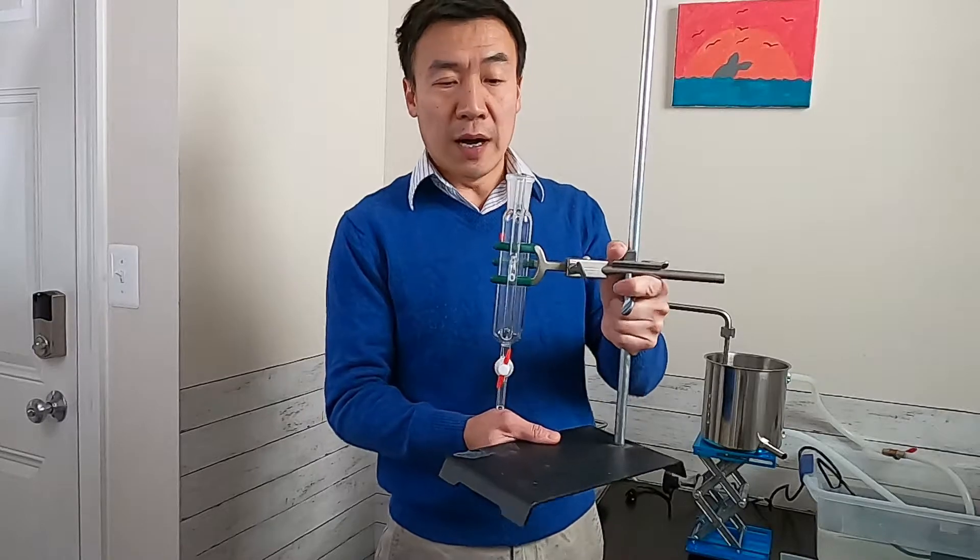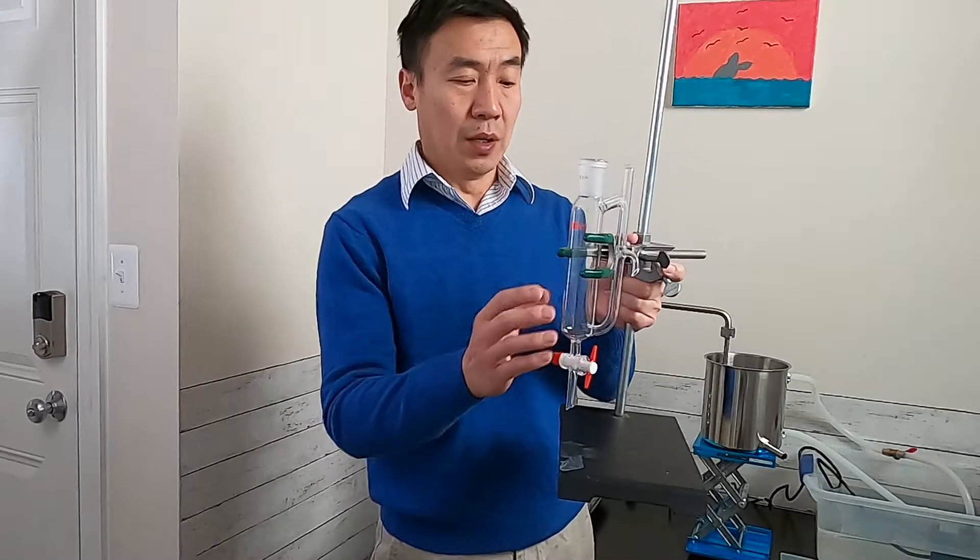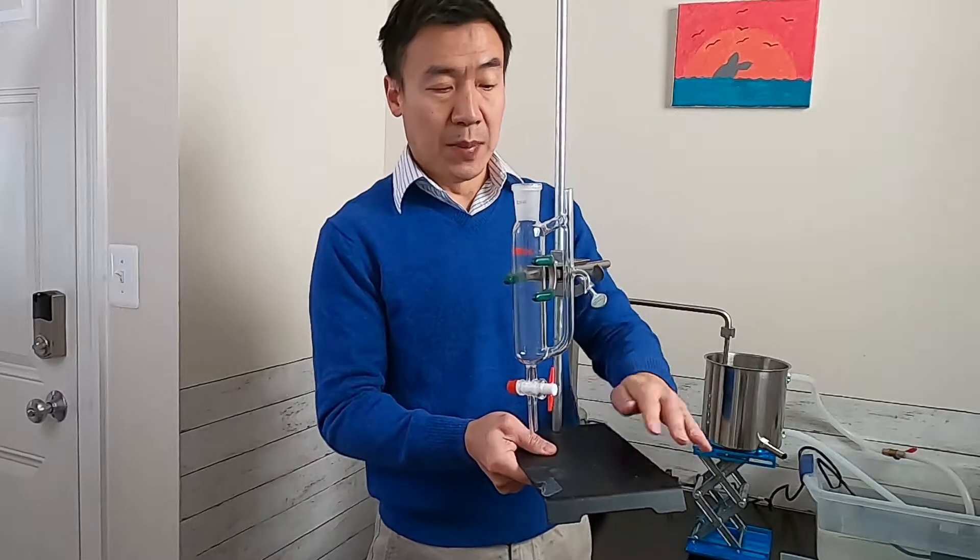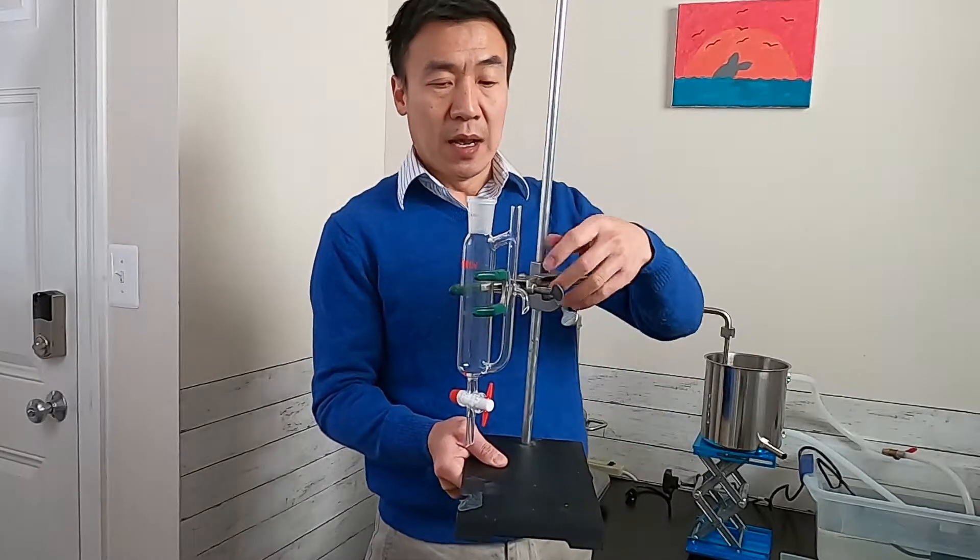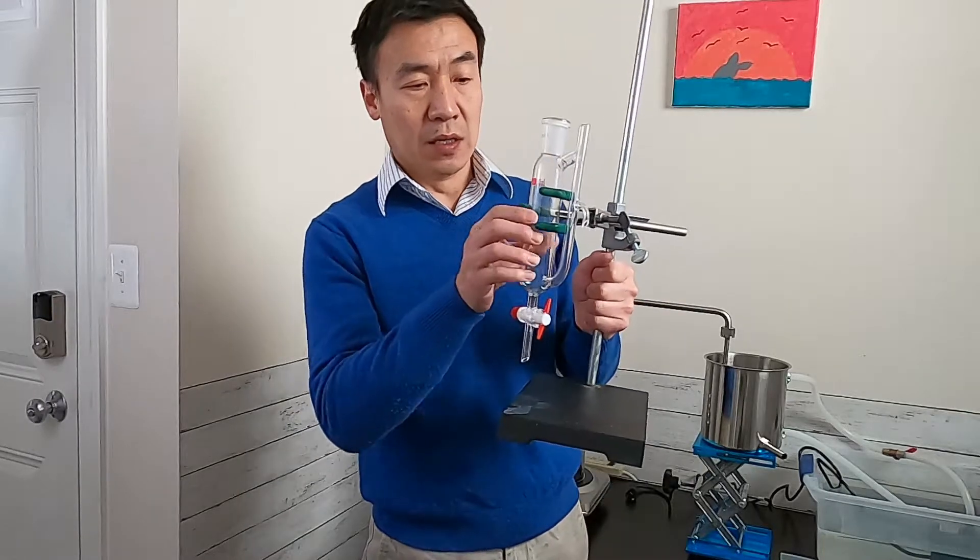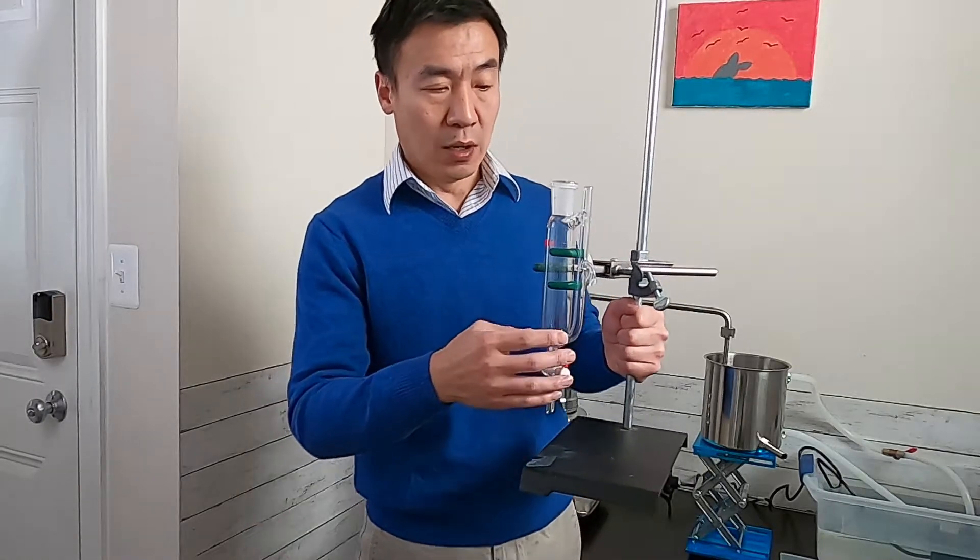The oil or hydrosol separator, you need a stand. It's basically just a base, a rod, and the most important part is the clamp. So you can grip this and hold it in position.